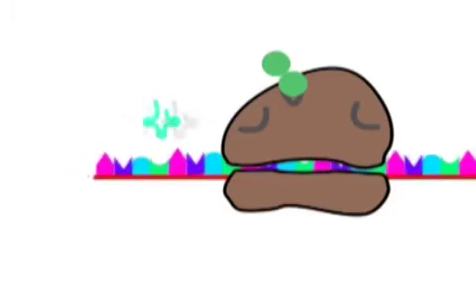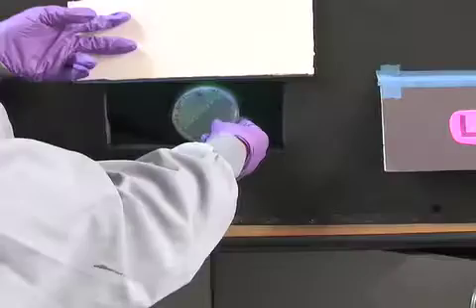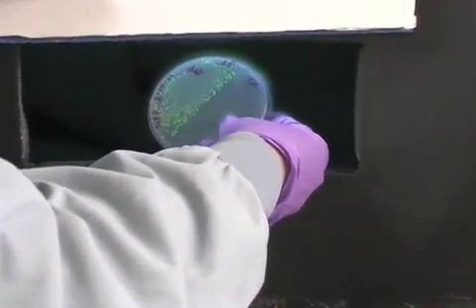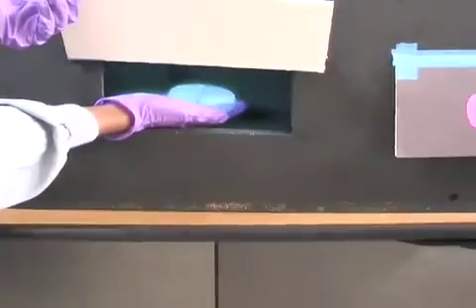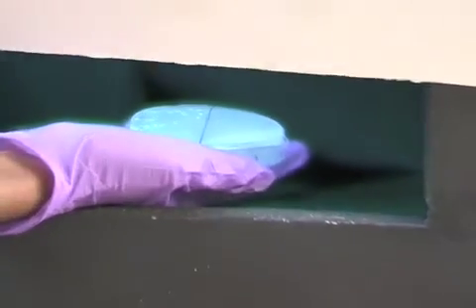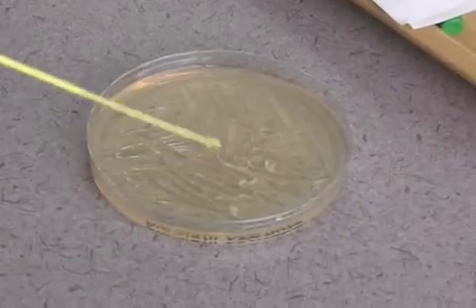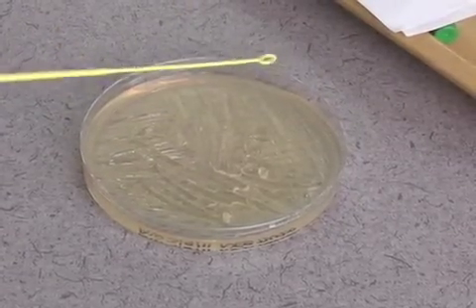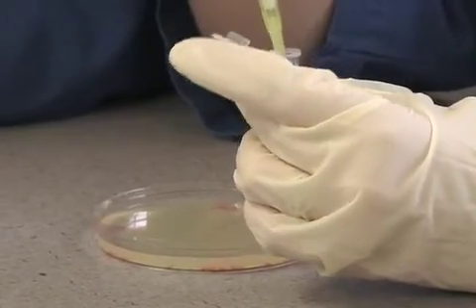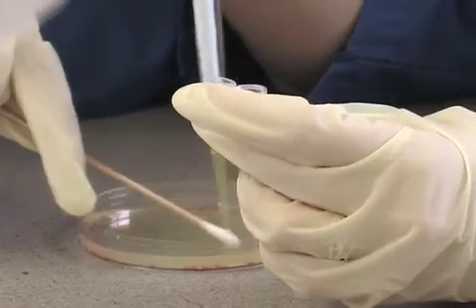When this new protein is completed, it will fluoresce either blue or yellow instead of green. If you notice on your plate that one half still glows green and the other half glows blue or yellow, that means your experiment was a success. In this lab, there is a controlled protein and a mutated non-controlled protein. The controlled DNA still has the original GFP DNA that glows green because it was only replicated through PCR and not mutated. The mutated DNA, which was incubated and multiplied, will express proteins that glow blue or yellow.